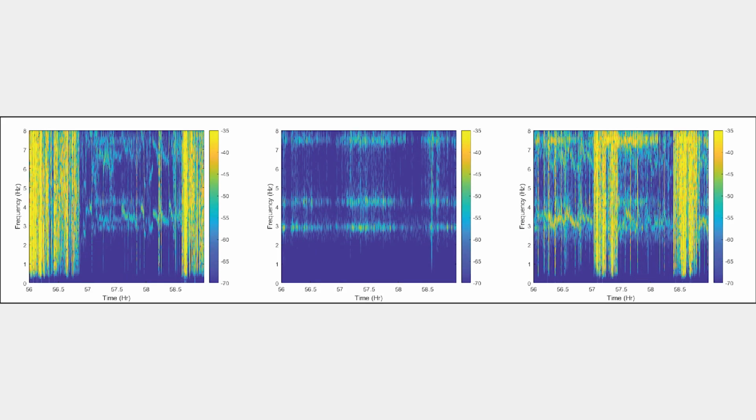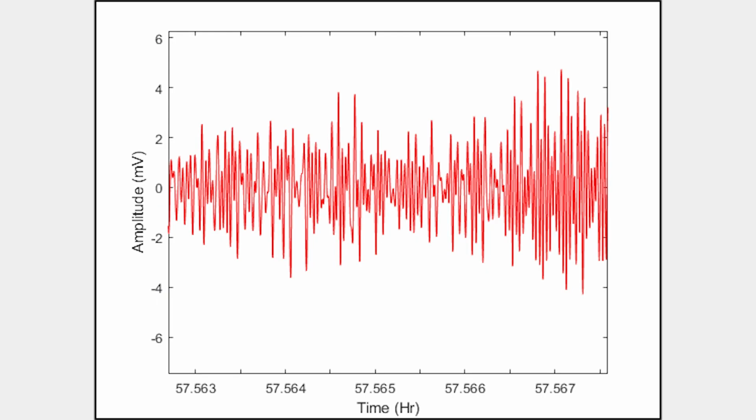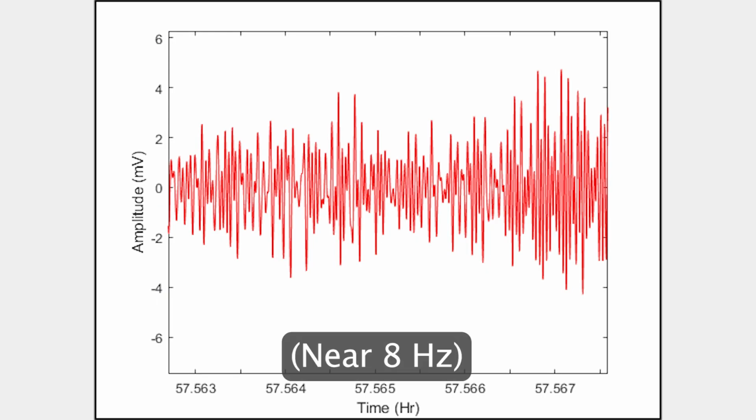Now let's look at the cages in the bottom shelf. Spectral patterns from the breathing signal are observed in both, along with the noise patterns. This is confirmed by zooming into the first cage. Here we can see an interval with stronger breathing signals and parts where it is weaker at the beginning and end. If we look at the time signal in the section where the spectrogram shows a weak breathing signal, we can see that the vibrations at the higher frequency mask much of the breathing signal.